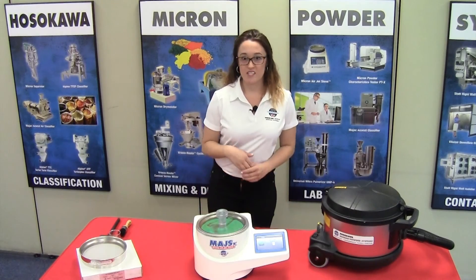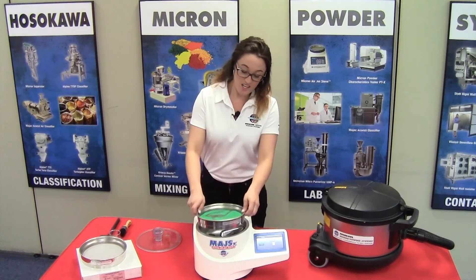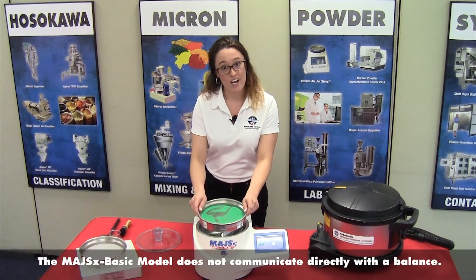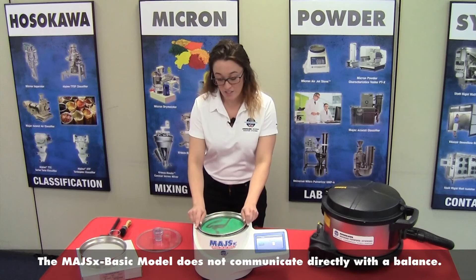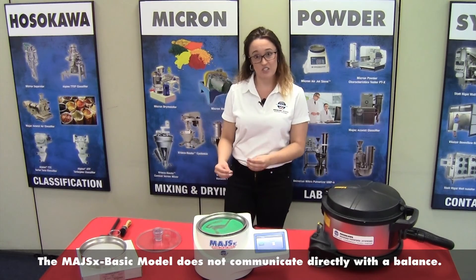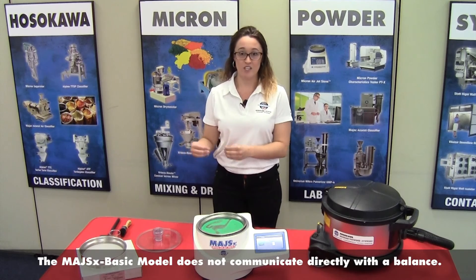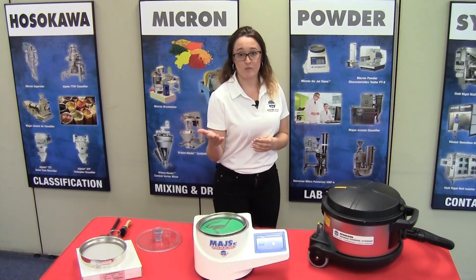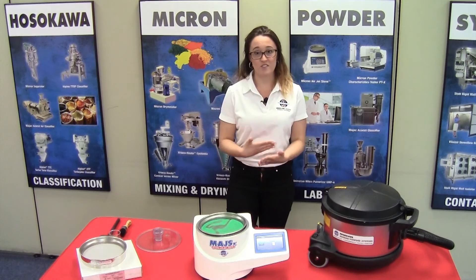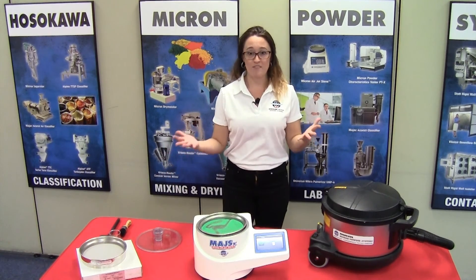Once sieving is completed, you can remove the cover and take your sieve screen with the sample retained and weigh it on the balance. When you weigh it on the balance, you can get the percentage that has passed through the sieve screen or the percentage that is retained on the sieve screen. Should your company call for a different protocol where you need to remove the sample off the sieve screen and weigh it like that too, that'll give you the same information.